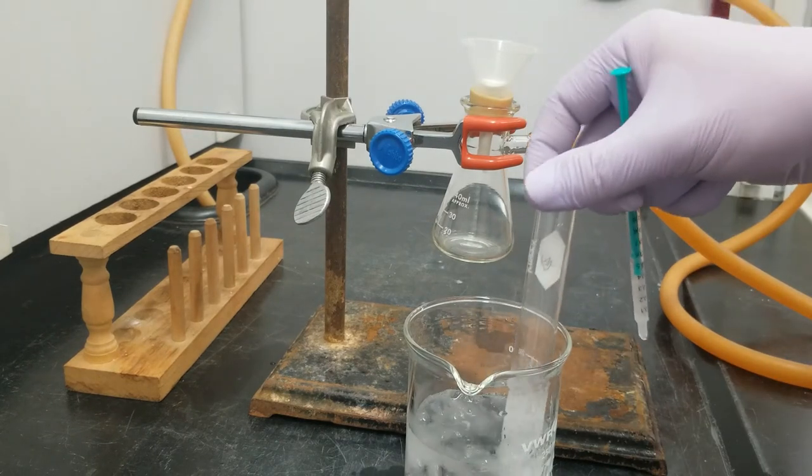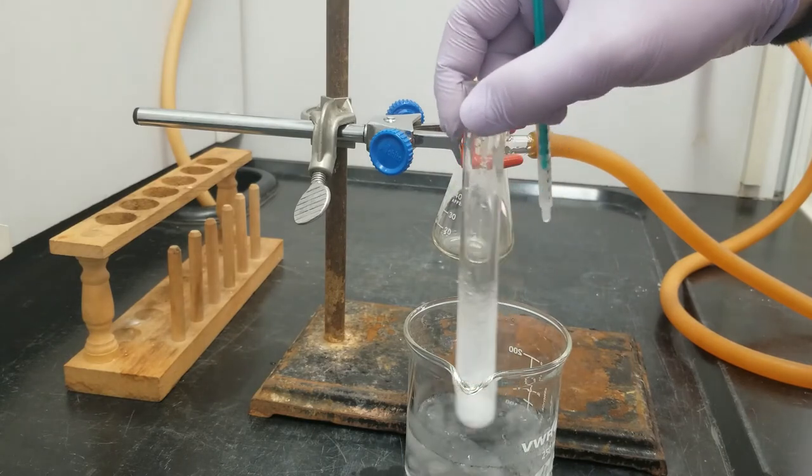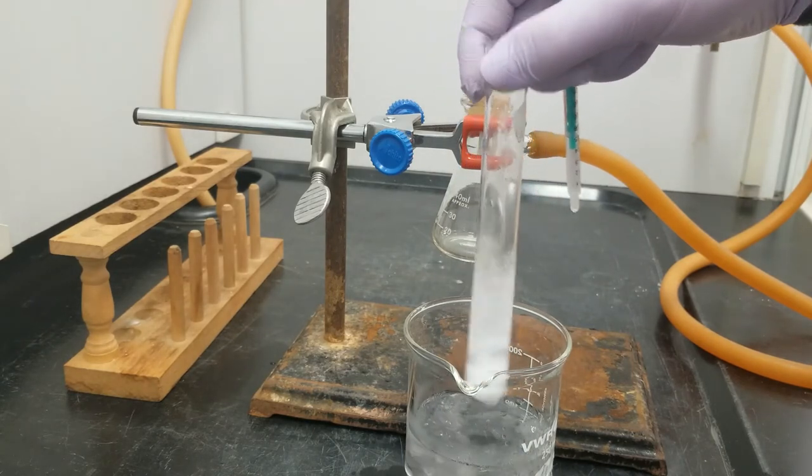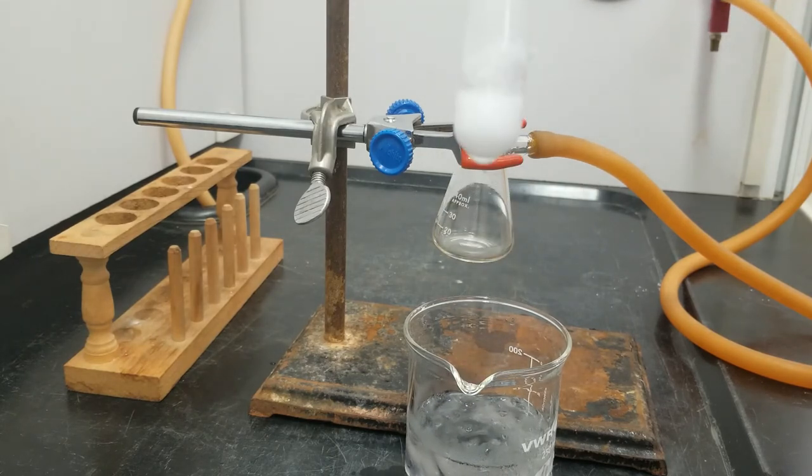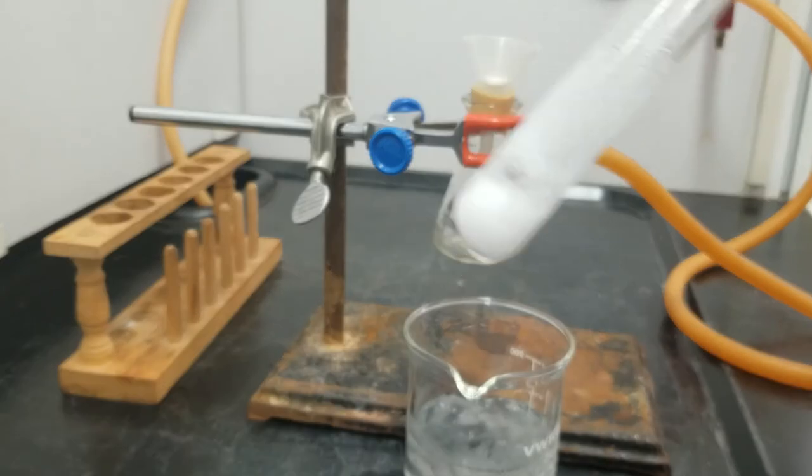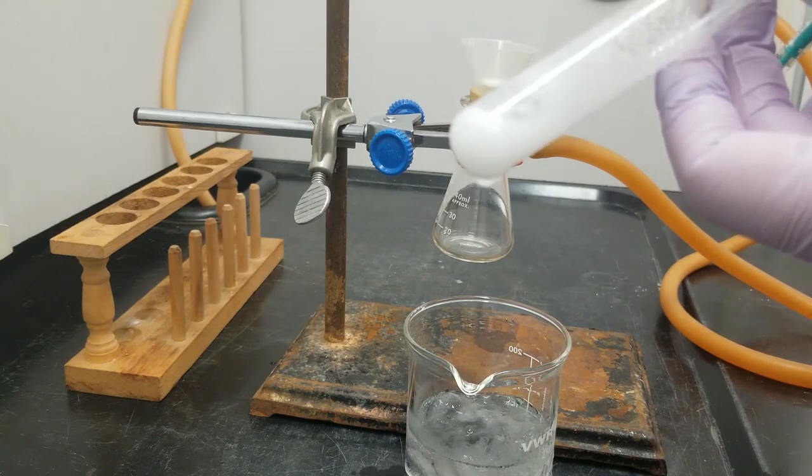Okay, so we are back after our 20 minute wait period. In order to quench the reaction, or to use up any of the remaining sodium borohydride, I've added a milliliter of ice water here. And you can see that our alcohol product has formed, and it's that white pasty solid, which is clouding up our solution here.